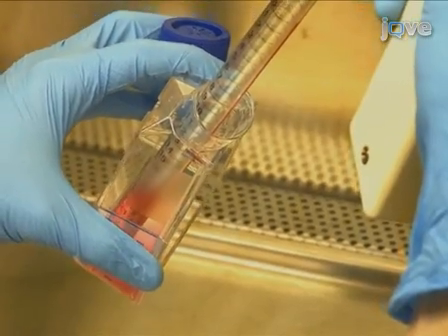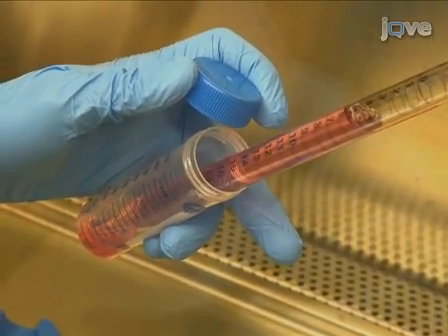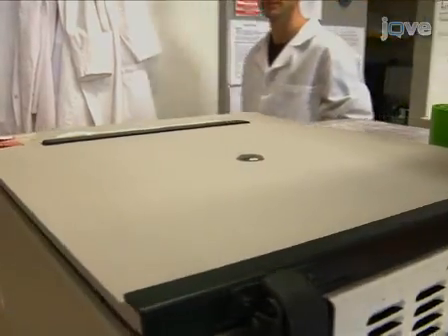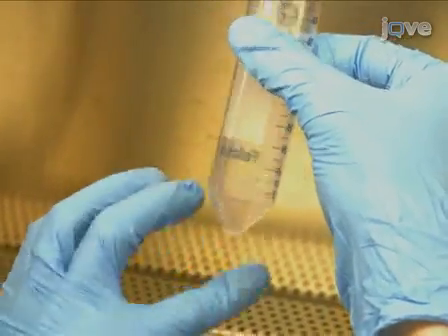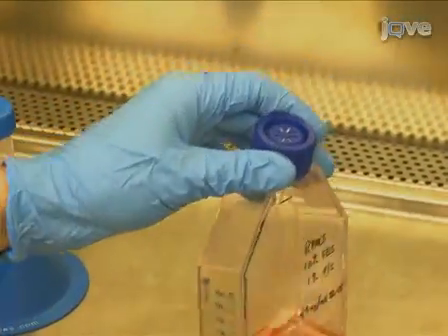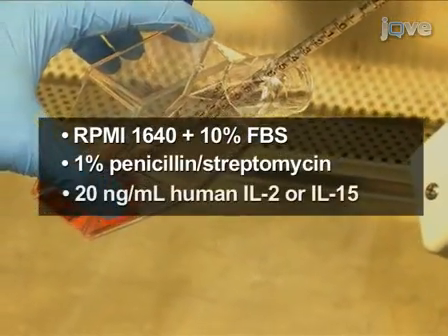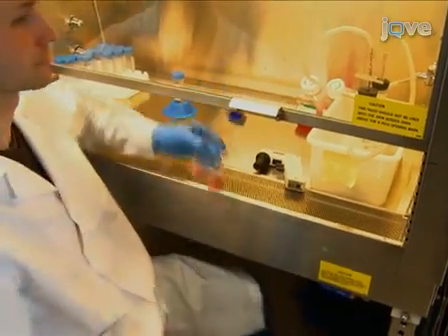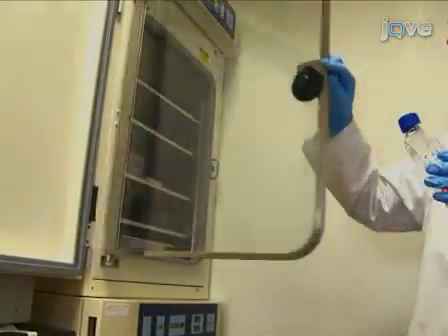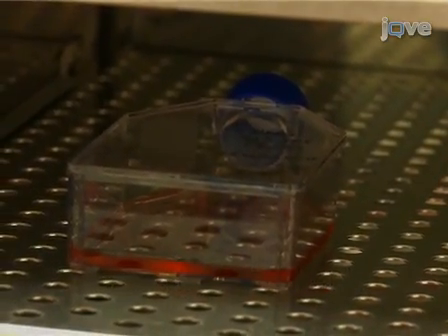After 3 days, use a pipette to remove the medium, which will contain suspended lymphocytes, and transfer it to a 50 milliliter conical tube. Centrifuge at 500 g for 5 minutes. Resuspend the cell pellet and transfer the cells to a new T75 containing 25 milliliters of RPMI 1640 with FBS, penicillin streptomycin, and human IL-2 or IL-15. Place the cells in the incubator. If starting a T75 flask, the culture will need to be expanded and transferred to a T175 flask after 1 to 2 days. Grow lymphocytes for a total of 4 to 7 days.